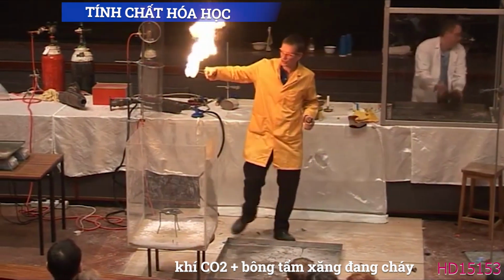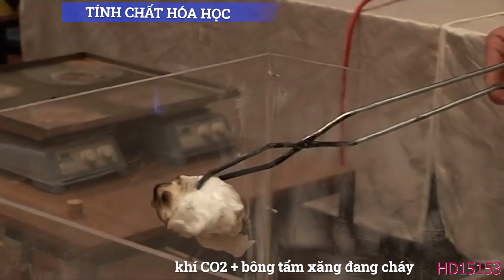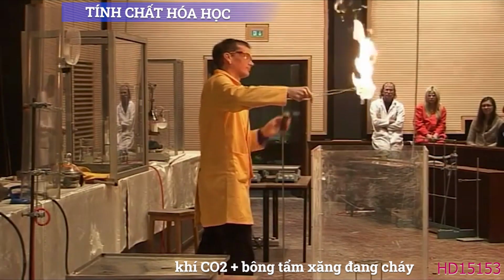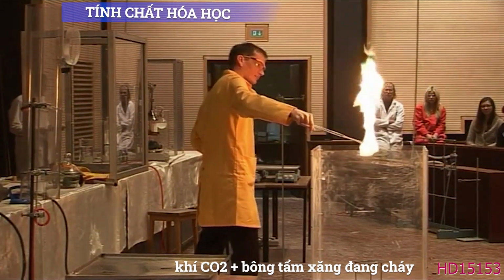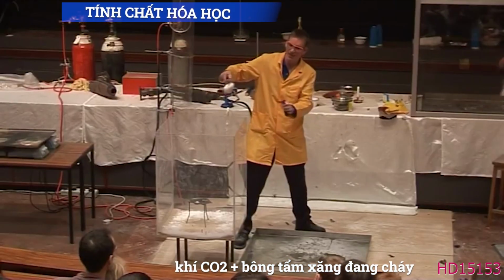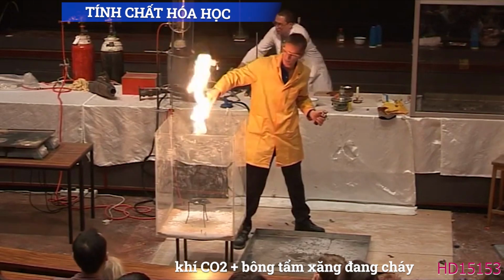So here we are, burning petrol into the carbon dioxide, and it's gone out. Let's try that again. So carbon dioxide is heavier than air, so it's staying in the tank, but as soon as I put the burning petrol in, it goes out.